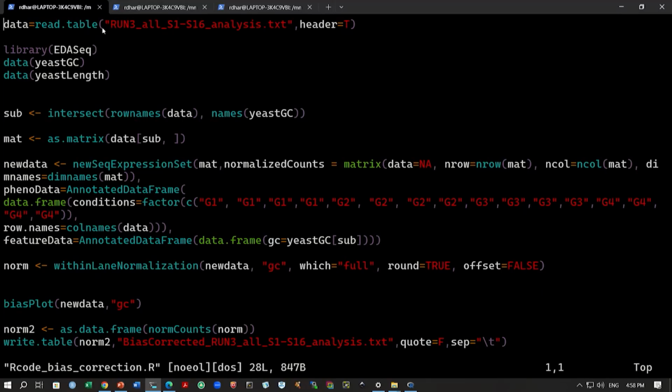So, we are loading this data, right. This is the raw count data that it will take, then it will take the library, right. So, we will load the library EDASeq, then we will load these two data sets that are part of this EDASeq library. Okay, so, yeastGC and yeastLength.